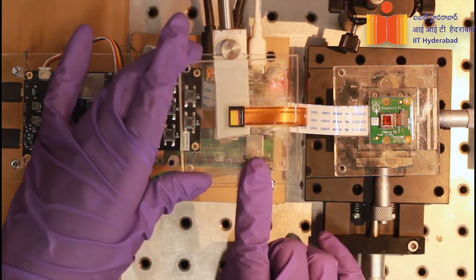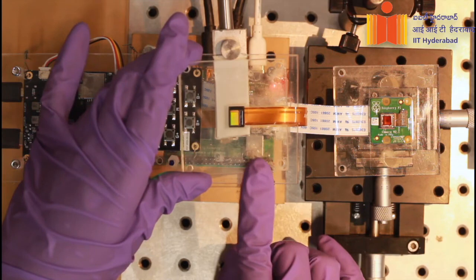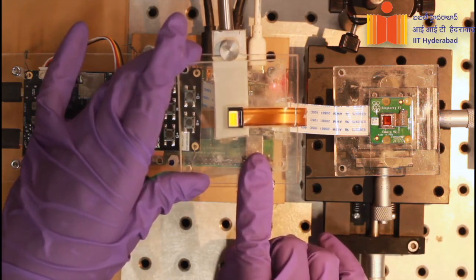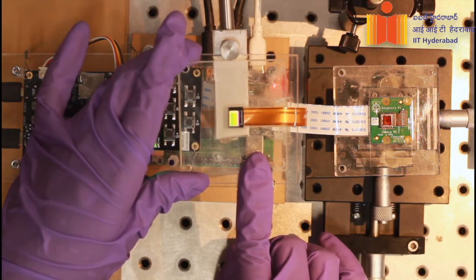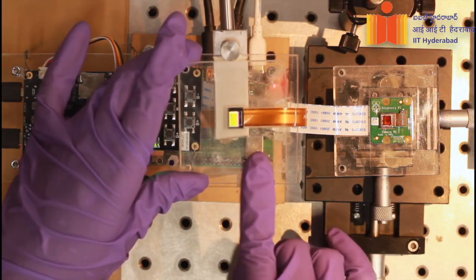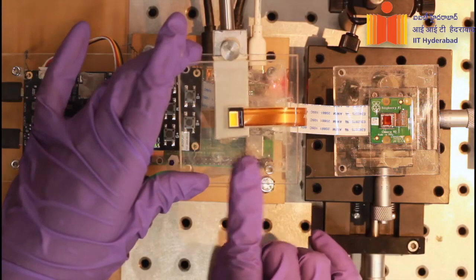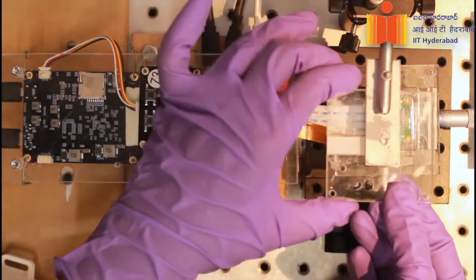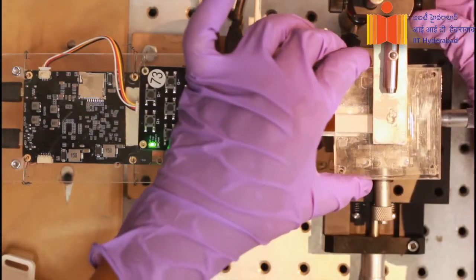The micro LED display is a small chip comprising a rectangular array of LEDs. Each LED of the chip is of micron dimension and is bright enough to be used as a light source. The actuation and the brightness of each LED can be controlled individually. So this is how we assemble Muscope.